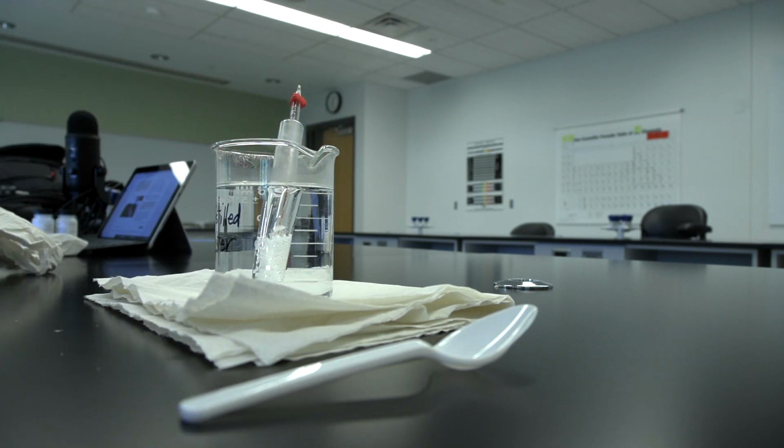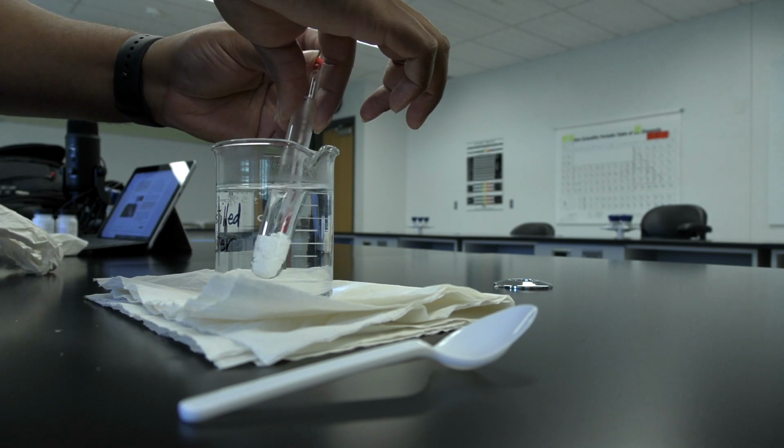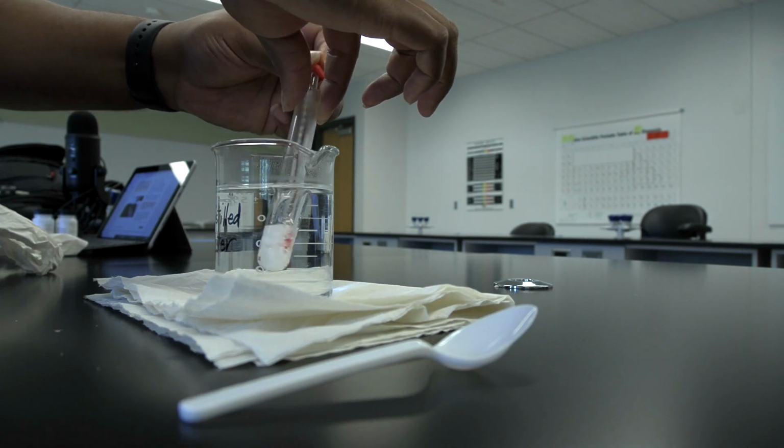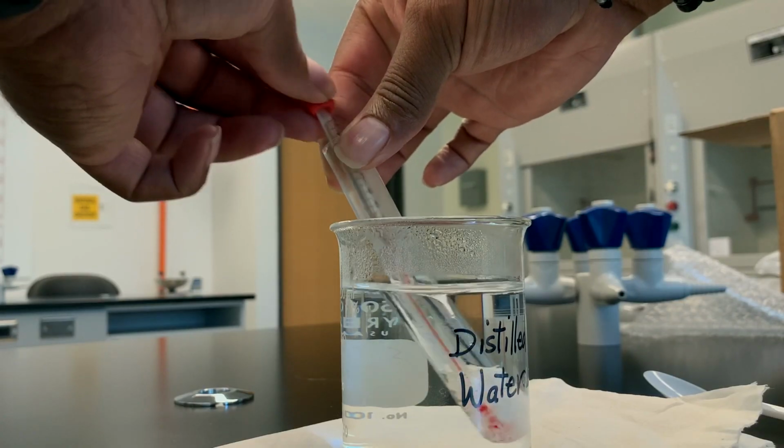Carefully tilt the test tube so that any lauric acid powder on the walls of the test tube will be melted by the hot water. Do not let any water from the bath splash into the tube. Keeping the test tube submerged with one hand, gently stir the solid lauric acid with the thermometer to speed its melting.